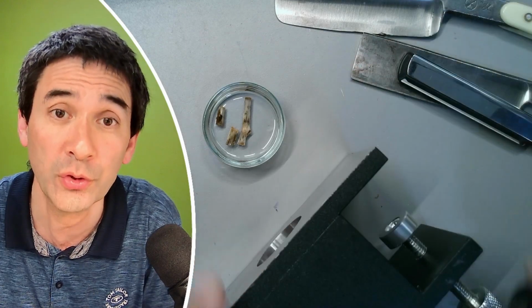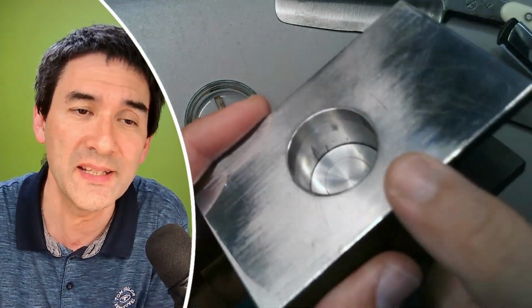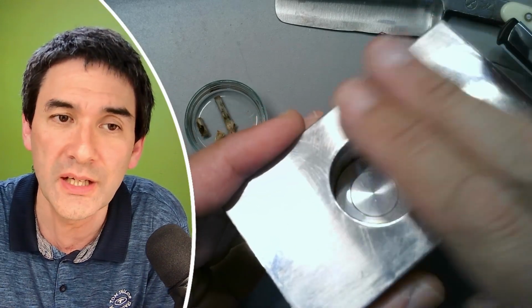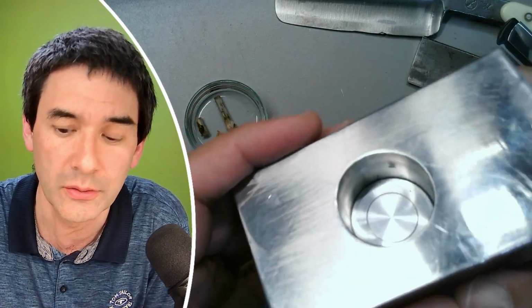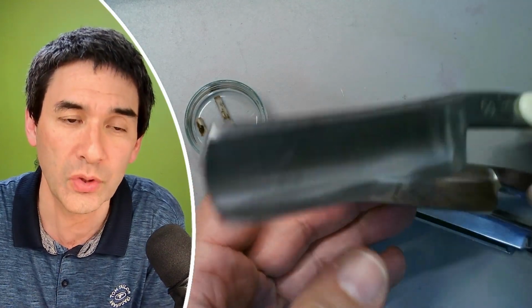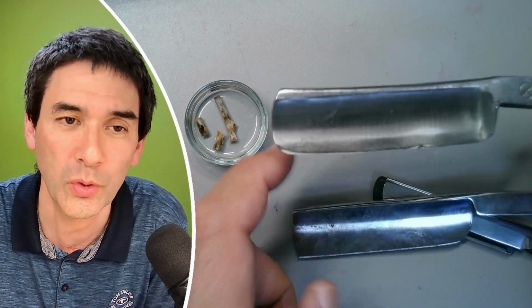And for those of you who don't know what a Microtome is, by turning the screw down here, I'm able to advance the specimen upwards little by little, so that I basically can use a knife and cut across it. Okay, and I would simply like to see now which knife works best, and I can already assume that probably these here are not going to work so well, because look at this.